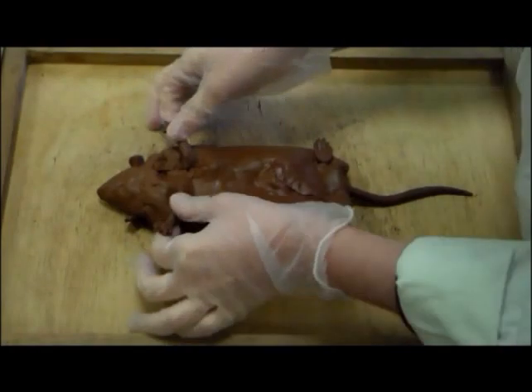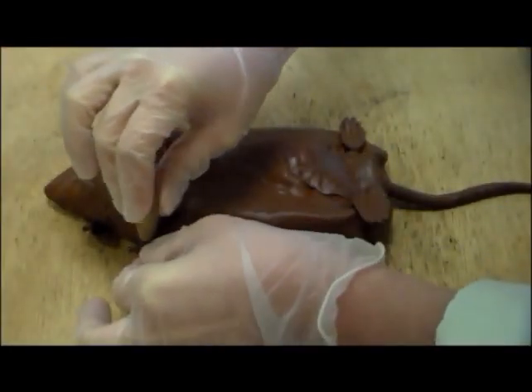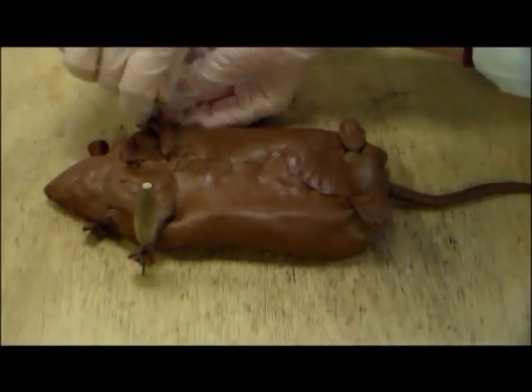To dissect a rat you will need a lab coat, gloves, dissection kit, pins, and a board.